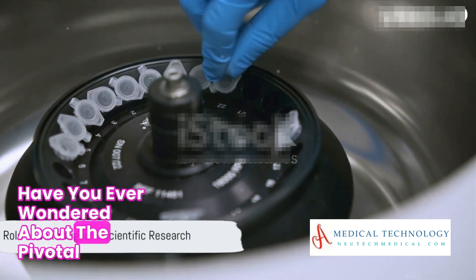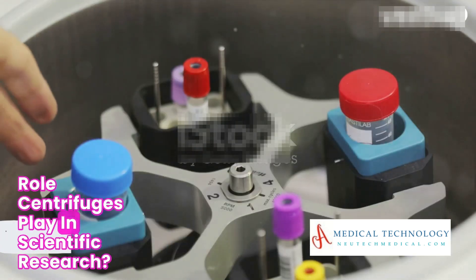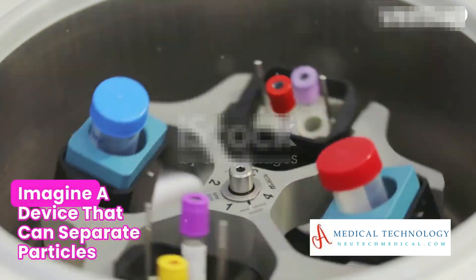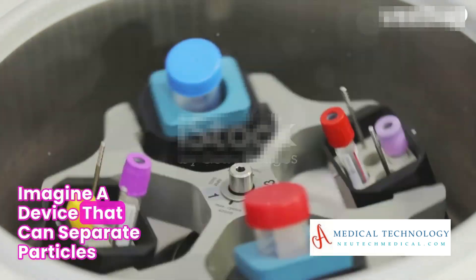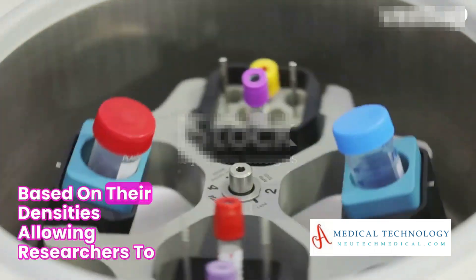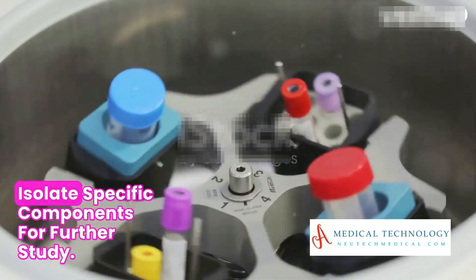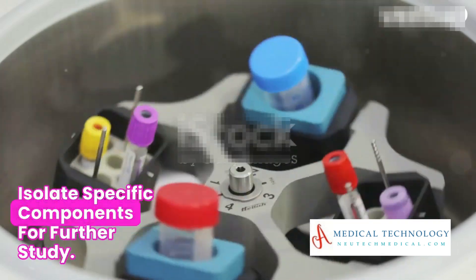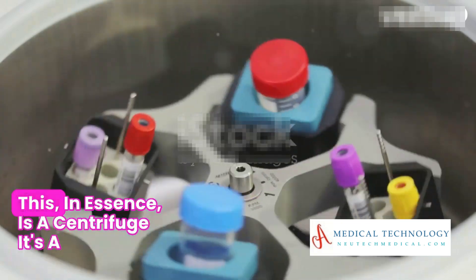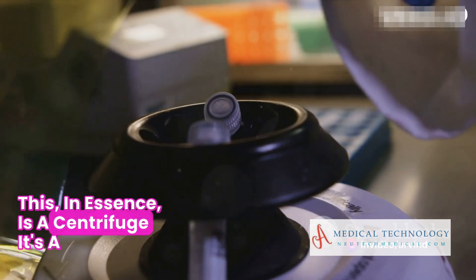Have you ever wondered about the pivotal role centrifuges play in scientific research? Imagine a device that can separate particles based on their densities, allowing researchers to isolate specific components for further study. This, in essence, is a centrifuge.